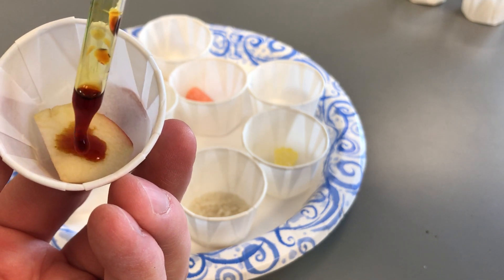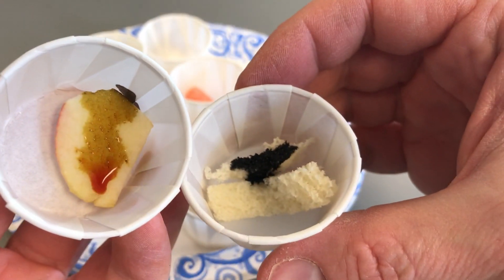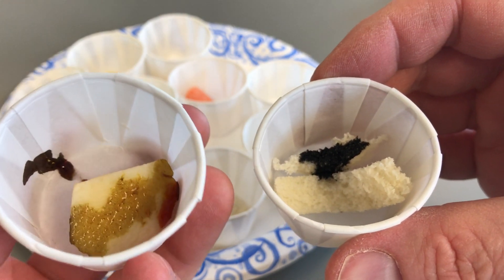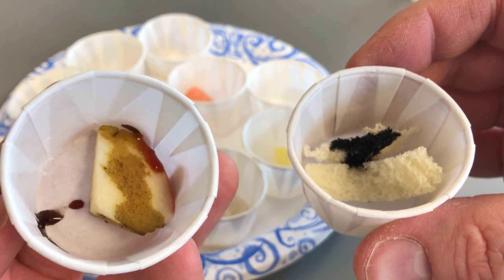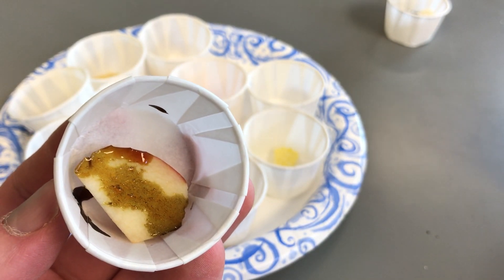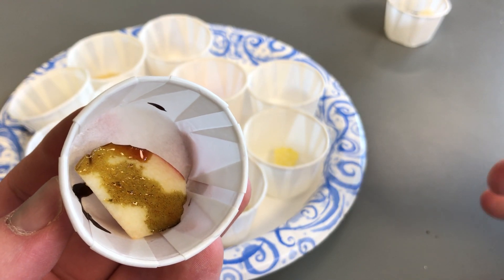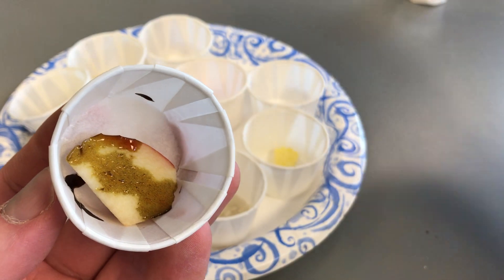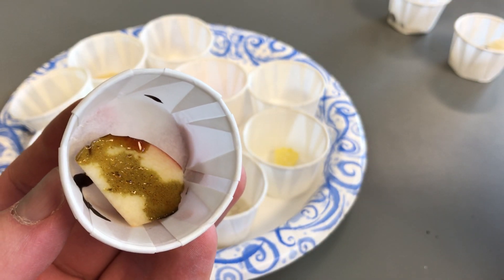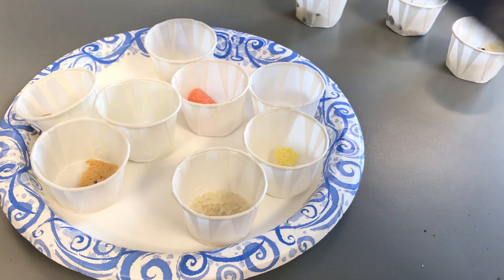Next is the apple. The apple doesn't really change color right away — it still stays that amber color. Comparing it to the bread, there's not much change initially. As it sits, it does start to darken a little, but there's still a lot of red color. Apples are sweet, so different parts may be sweeter than others. There's a lot of amber indicating sugars, but maybe not a lot of starch. Because it's changing slightly, we can argue there are some starches present, just not as prominently as in flour or bread.